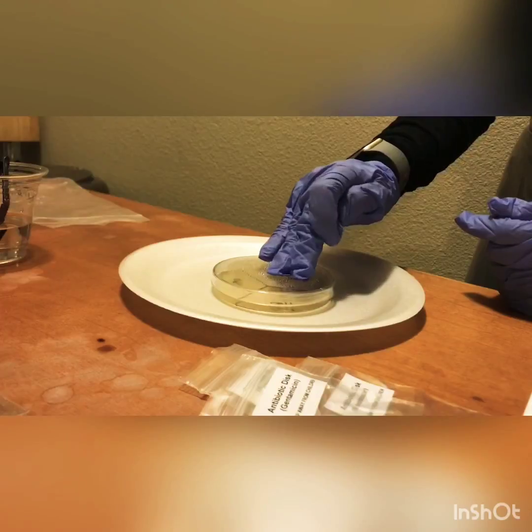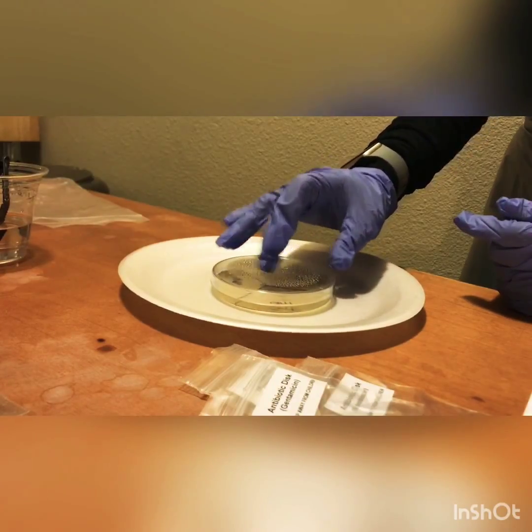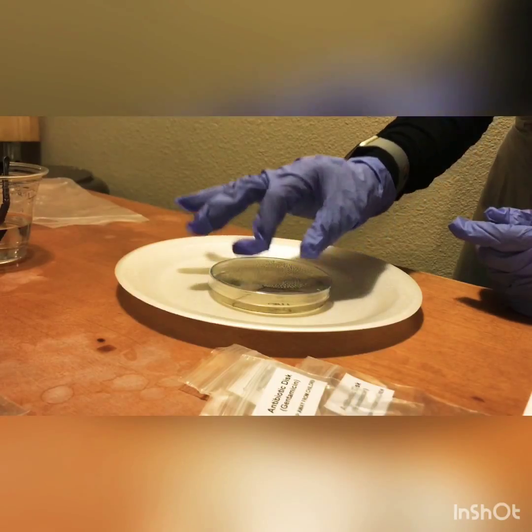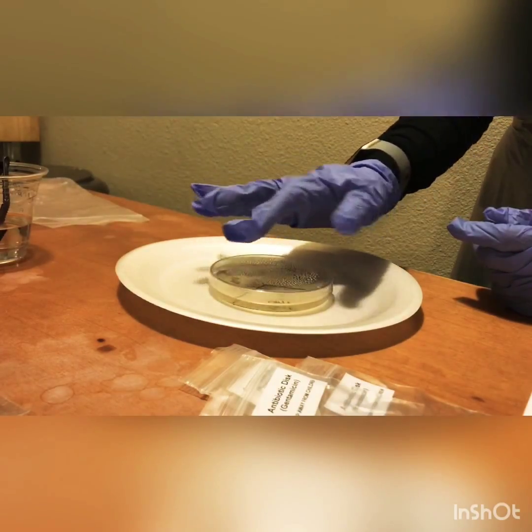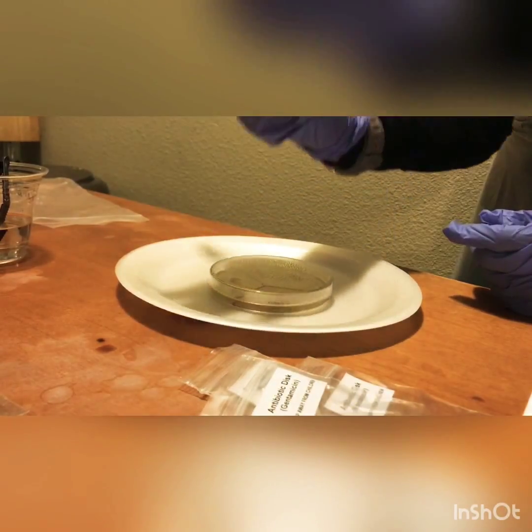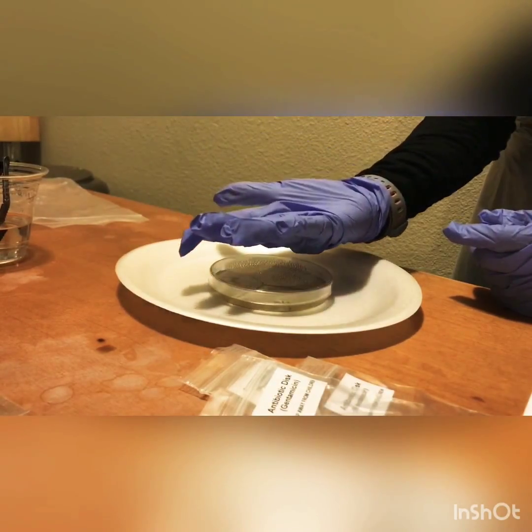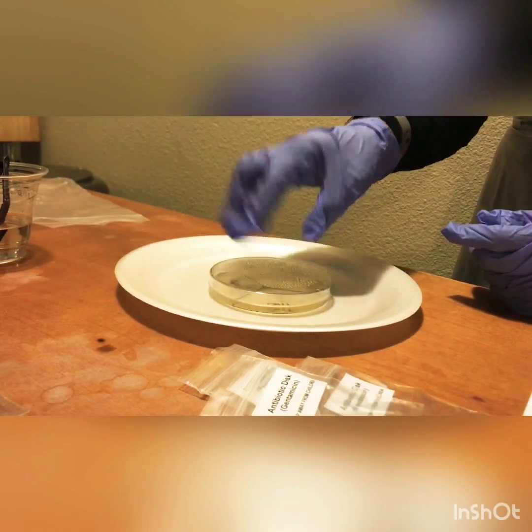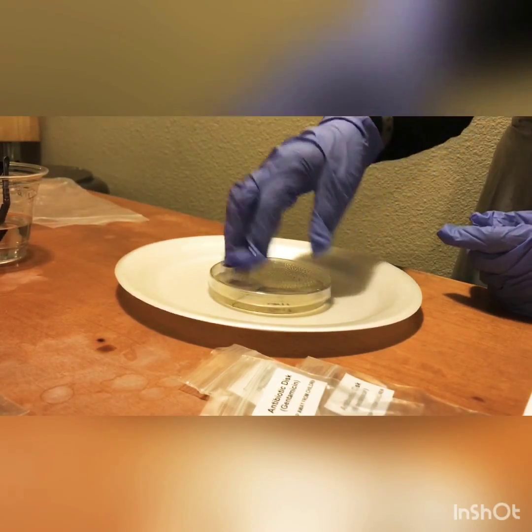It says that we're going to allow the agar plate to remain lid side up for the next 10 minutes, so those antibiotic discs will attach securely to the agar. At that point, we're going to place it agar side up in our incubation location for 12 hours. Then we'll observe that and document it.